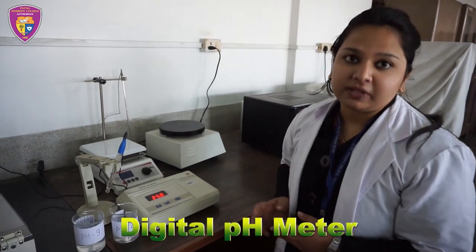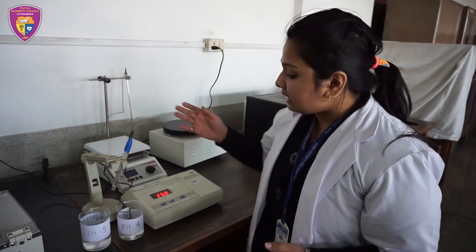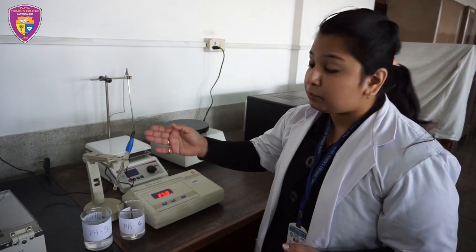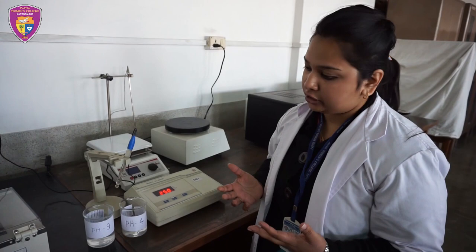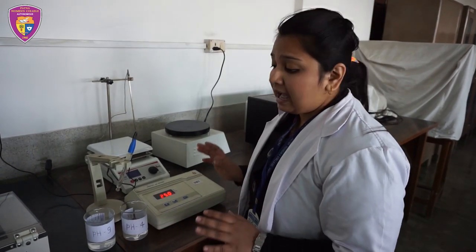This digital pH meter mainly works on the principle of determining the acidity or the alkalinity of a solution. It mainly consists of a probe made up of glass connected to an electric meter which displays the pH value of a solution. This device is already calibrated at pH 9 and pH 4.